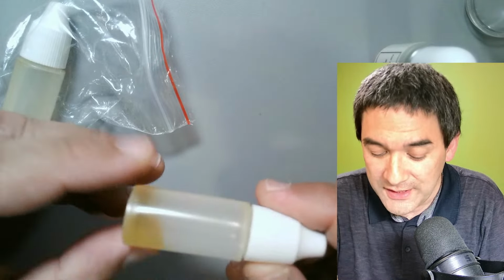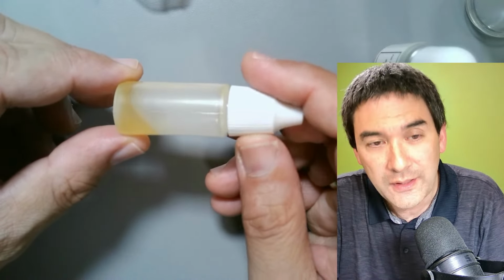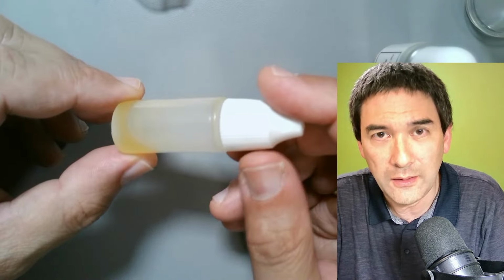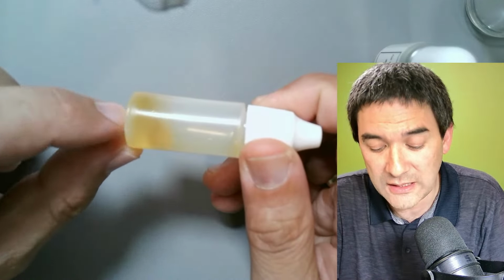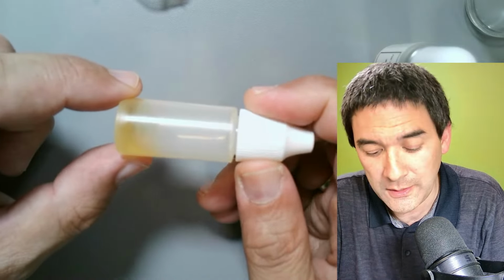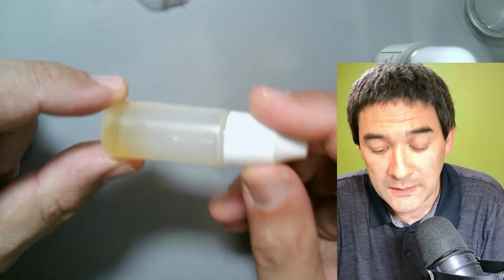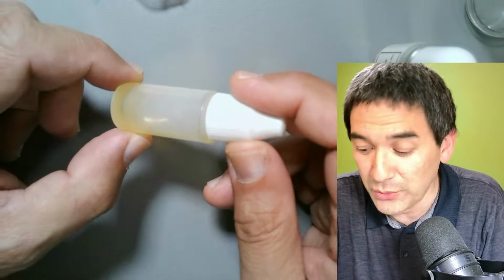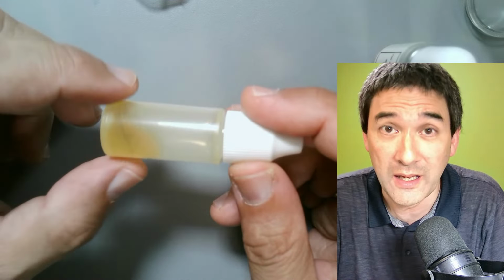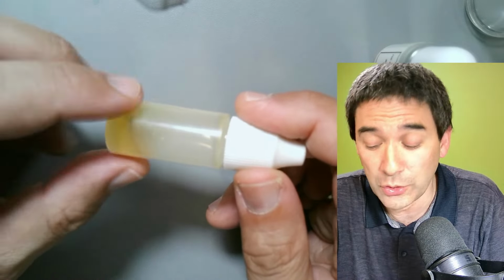Okay, so this is already another thing that I need to say. Look at this here. The immersion oil, the natural immersion oils, and you know that it's natural because of this yellowish color, will over time start to solidify. This basically means that you have to properly clean the objective after every use, okay? Because otherwise with time it's going to collect dust and dirt, and it might also turn solid.